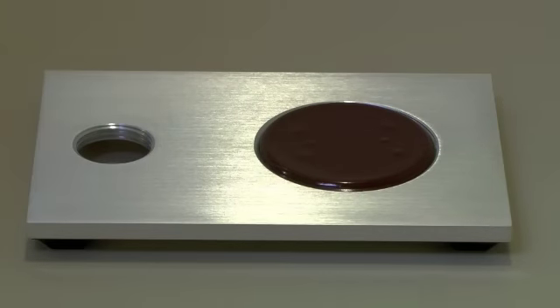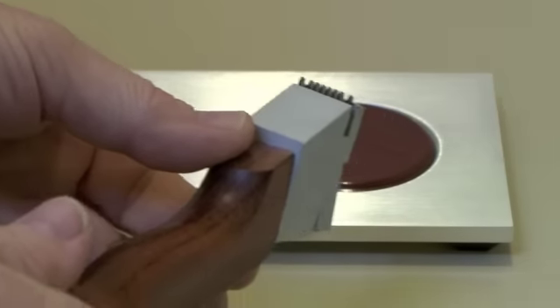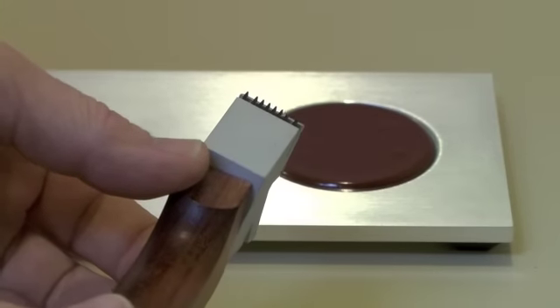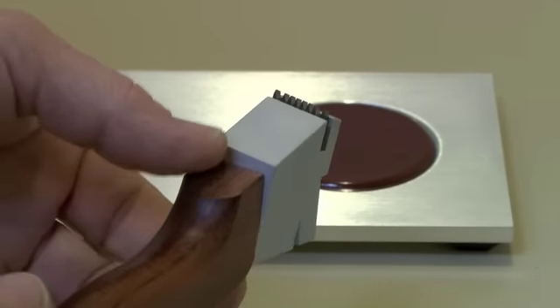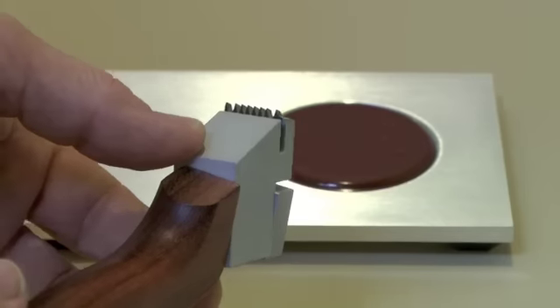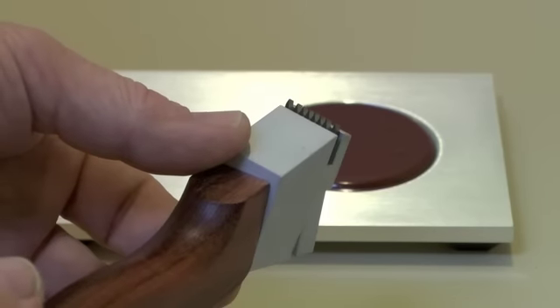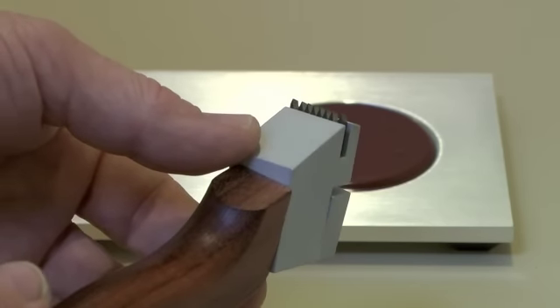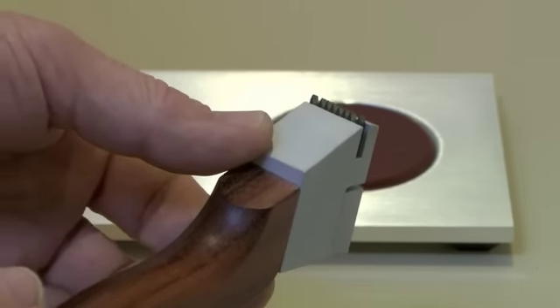Before we start making the actual cuts, let's take a closer look at the cutter. The crosscut tester has a handle that holds a blade. The blade holder portion swivels slightly to automatically align the cutter blades with the surface that you are cutting.